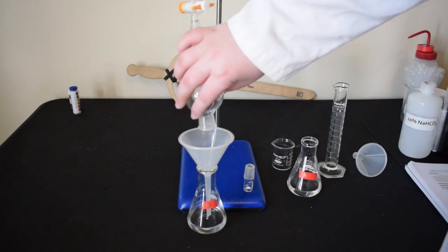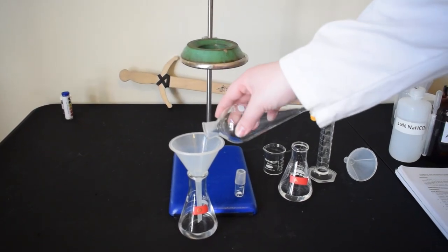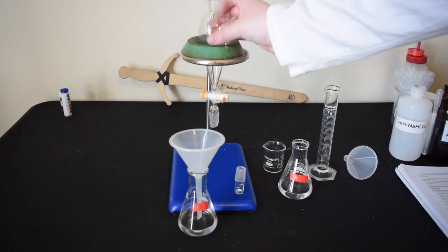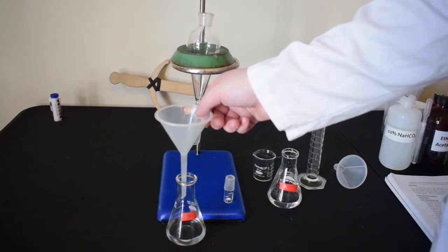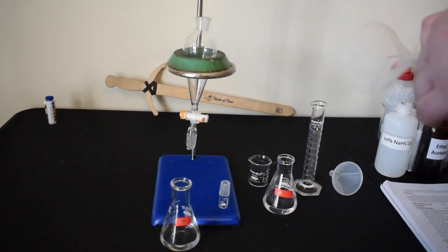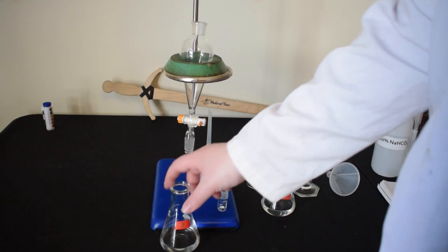With that, our extraction is now complete. We have an organic flask containing ethyl acetate and acetaminophen and an aqueous flask containing aspirin dissolved in water.